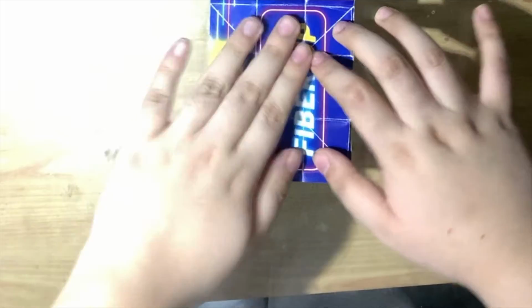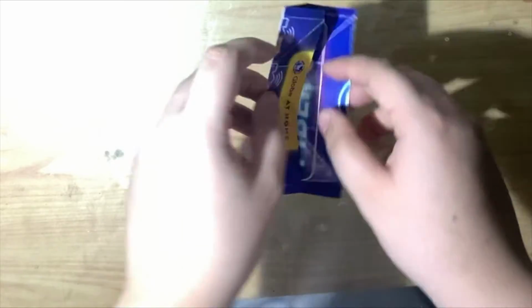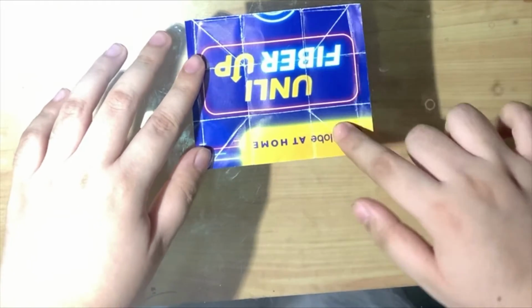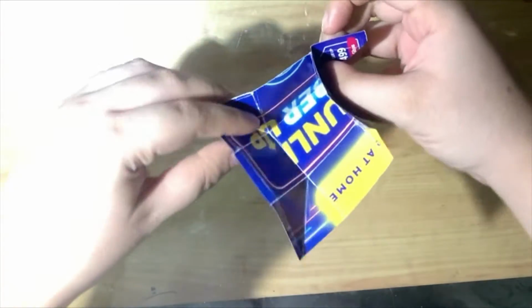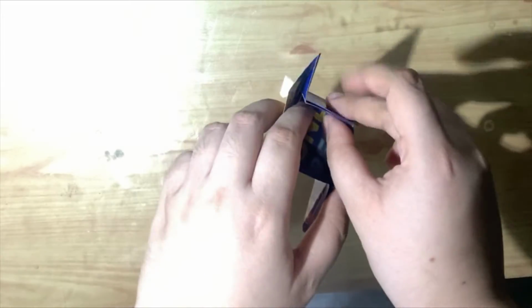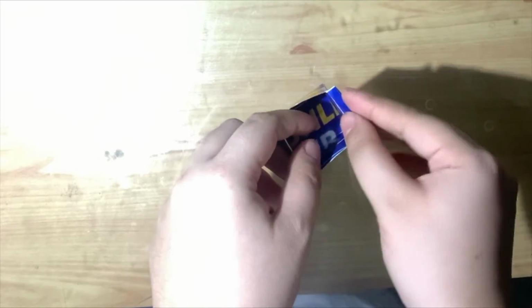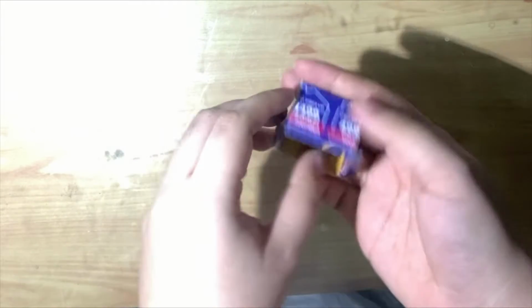This time, I will be teaching you how to make paper boats, which can be an alternative for tissue cassettes. First, we fold it 3 times lengthwise as well as 3 times crosswise. By now, we have 9 boxes and we now fold the corner boxes and let the perpendicular lines meet. The 4 flaps will now be folded towards each other and the resulting flaps will be folded outwards. And now, we have an improvised cassette for our specimen.